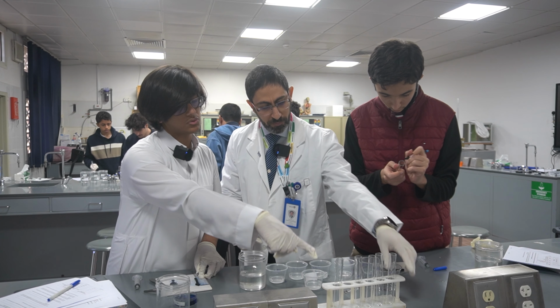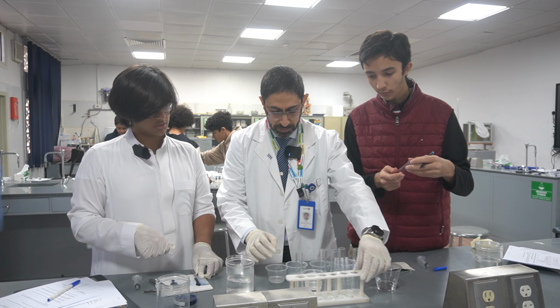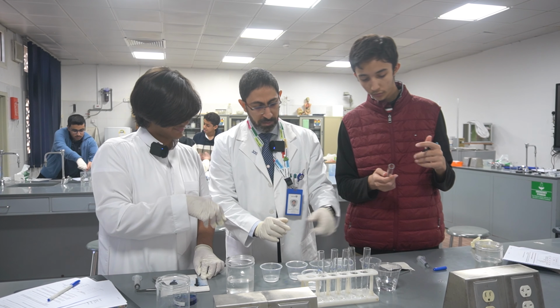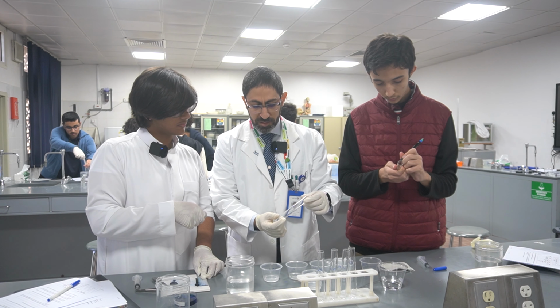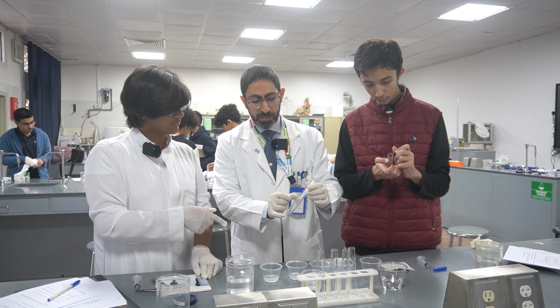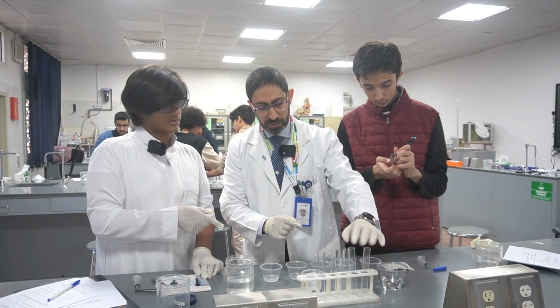And you will place each one of them where? After the solution, we put it over here. We'll take some of the potato and put it. So you have here how many concentrations? We have 5. And I think the water will be used. Why label the test tube here as W? Because we need a control, which is 100% undiluted. So it will be distilled water.